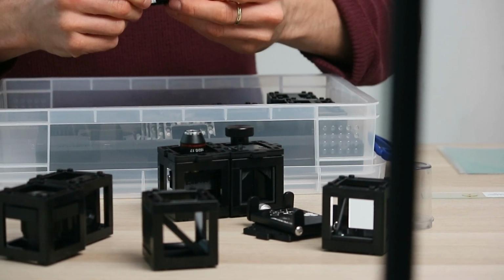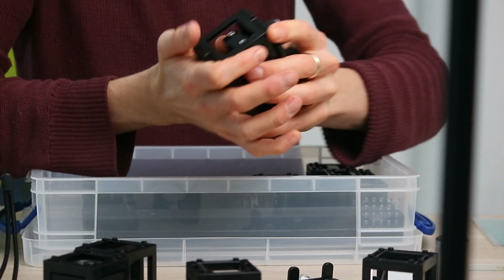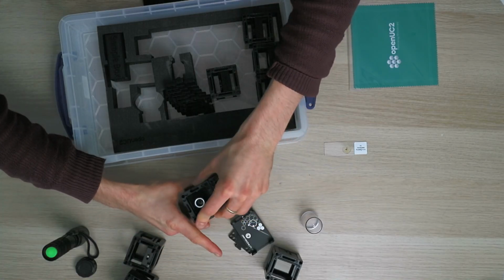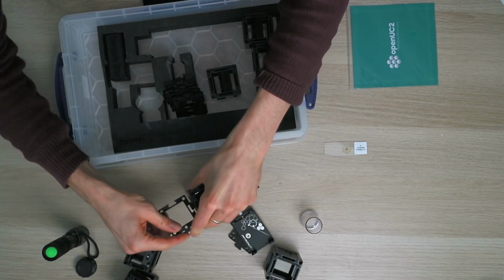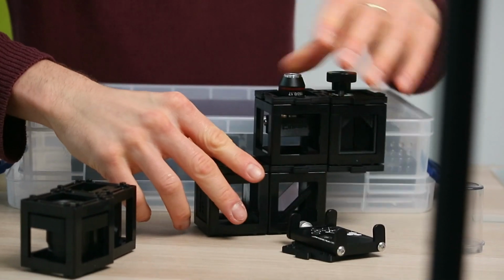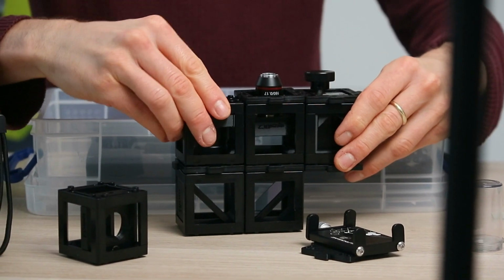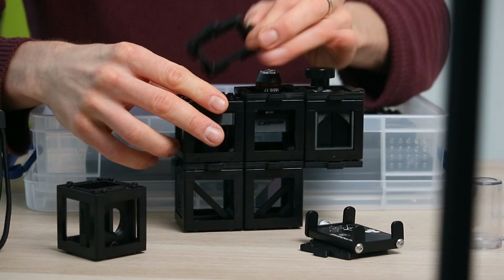So below this piece here, you need to have the folding mirror, which goes right here. And then yet another folding mirror. And you're almost done. So with this, you then add the eyepiece, and this is already a microscope.